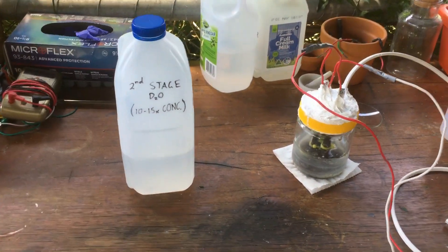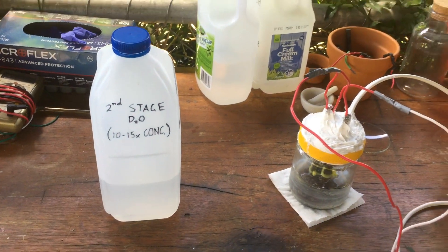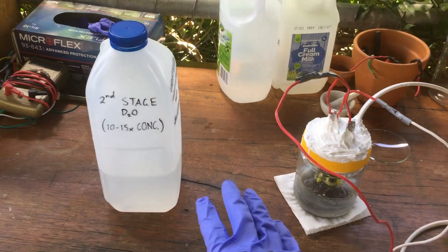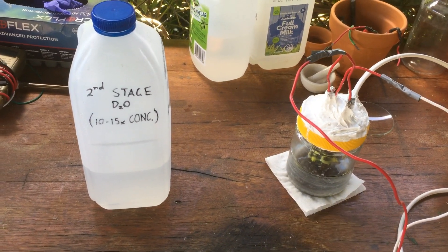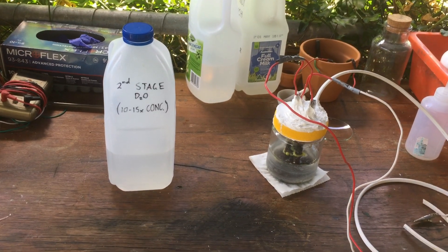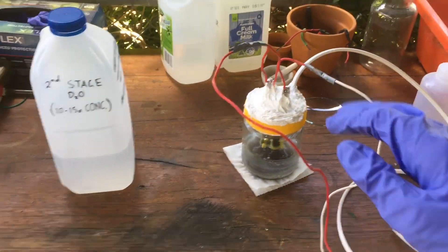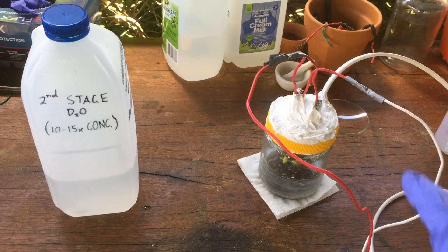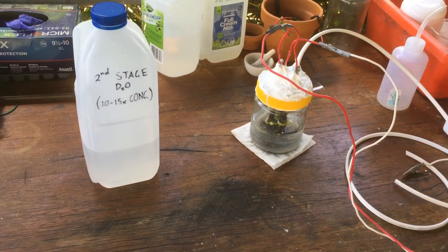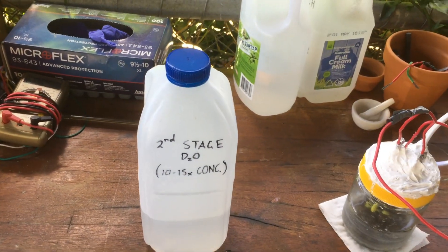Hopefully within the litre that we have, we've got between one and a half to two millilitres worth of pure heavy water. Over the next month or so, I'm going to continue electrolyzing down this litre of water until we have — using this electrolytic cell — maybe 100 to 200 millilitres, by which point it should be nearly 1% heavy. I've been running the cell pretty slowly lately, only between 3 and 5 amps, a lot slower than the 10 amps that I had previous cells running at, but I think at lower amperages it should have a better separation factor.